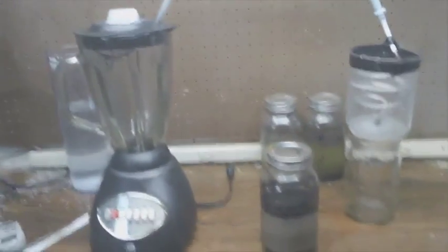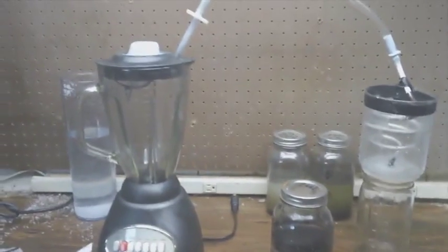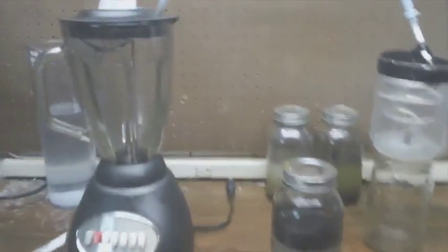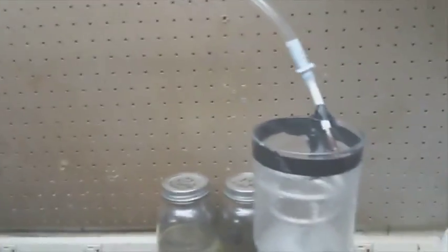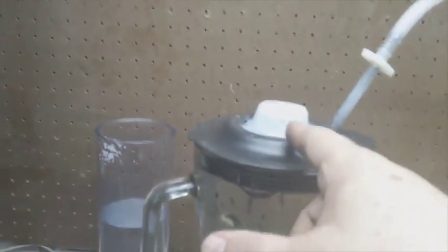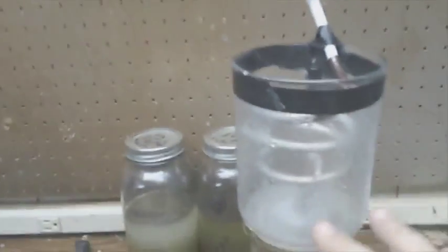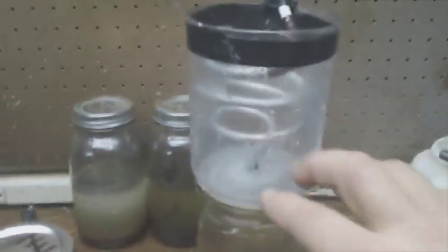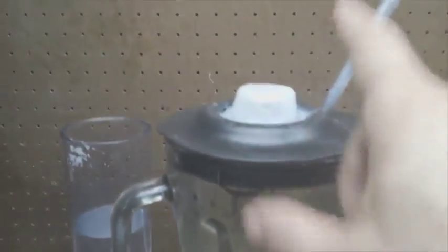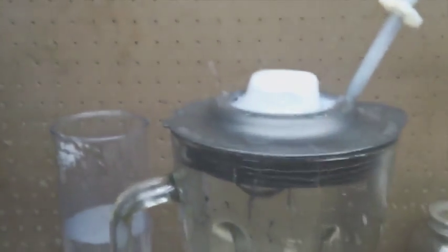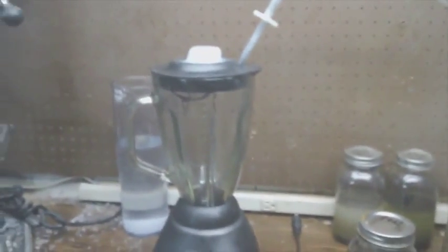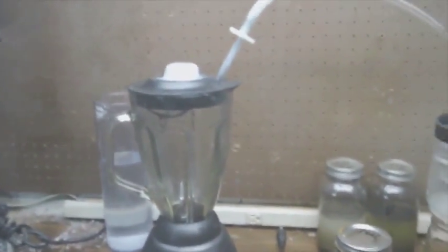This is working really well. I'm pretty pleased with this setup. I thought about making something that would just sit on top of here because it's condensing. That's changing the pressure ratio in the condenser. It could almost be mounted in a closed loop on the lid. You'd probably have to purge it to get it started, but I'm pretty sure you could make it self-contained without too much issue.